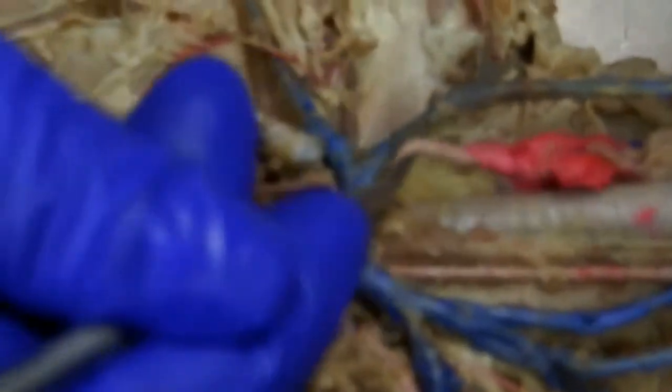You see a little blowout there. Right here becomes your right subclavian, and this little guy coming off there — that's your vertebral. This is axillary; follow axillary, follow axillary, and kind of get lost out here.